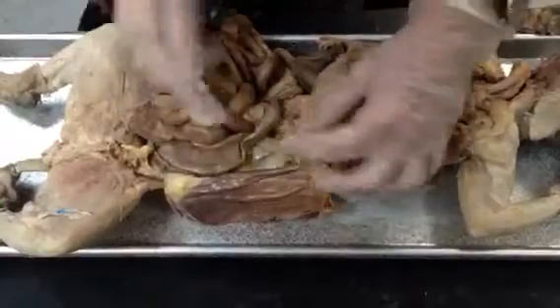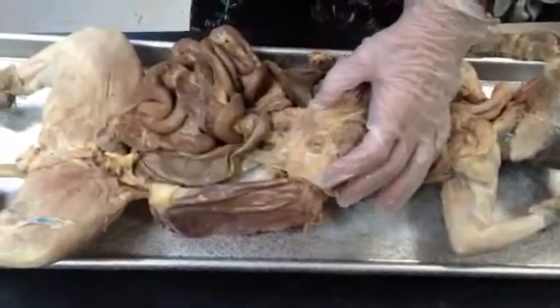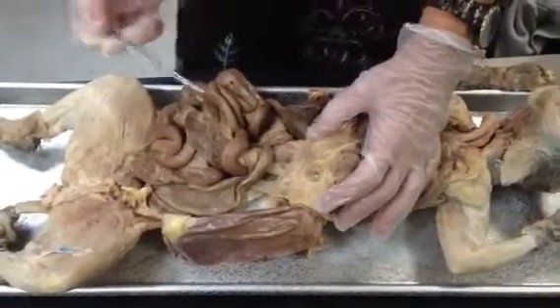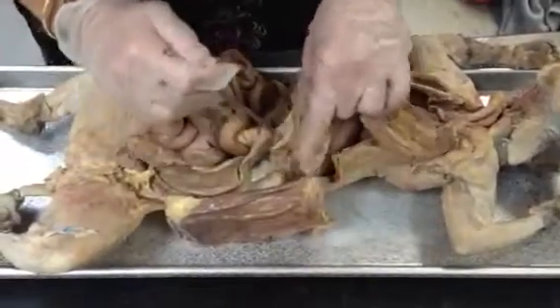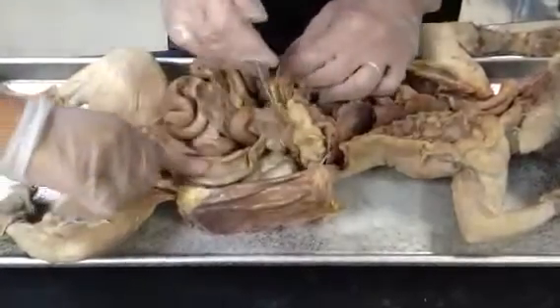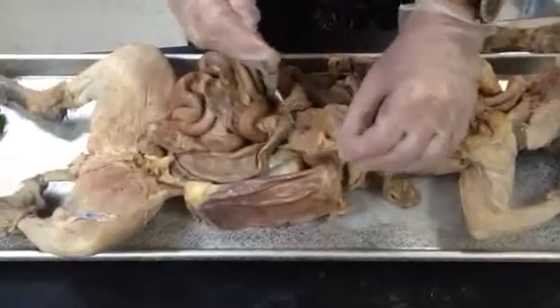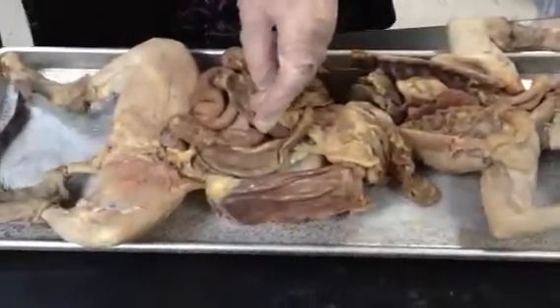Let's see if we can. Okay. Here's your pancreas here. It's real pink. This is a really fresh cat, okay? Not all the cats have a nice, fresh, pink pancreas, all right? There's the pancreas. This is the spleen. That's the spleen, kind of brown part over here. Pancreas, see how the tail comes over here and comes right up to the spleen. Okay. All right, pancreas, spleen.